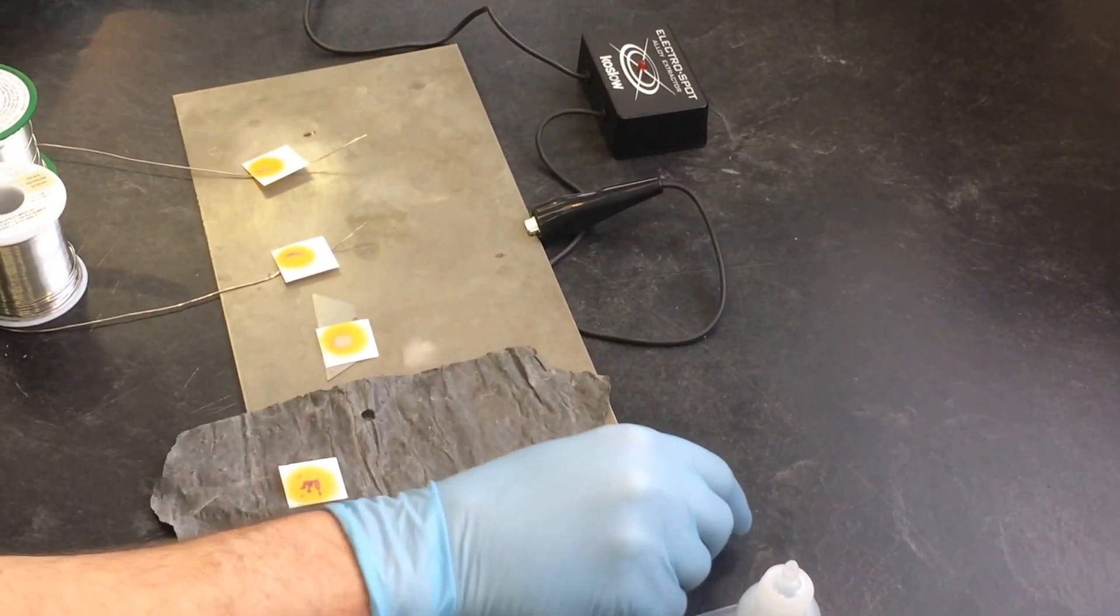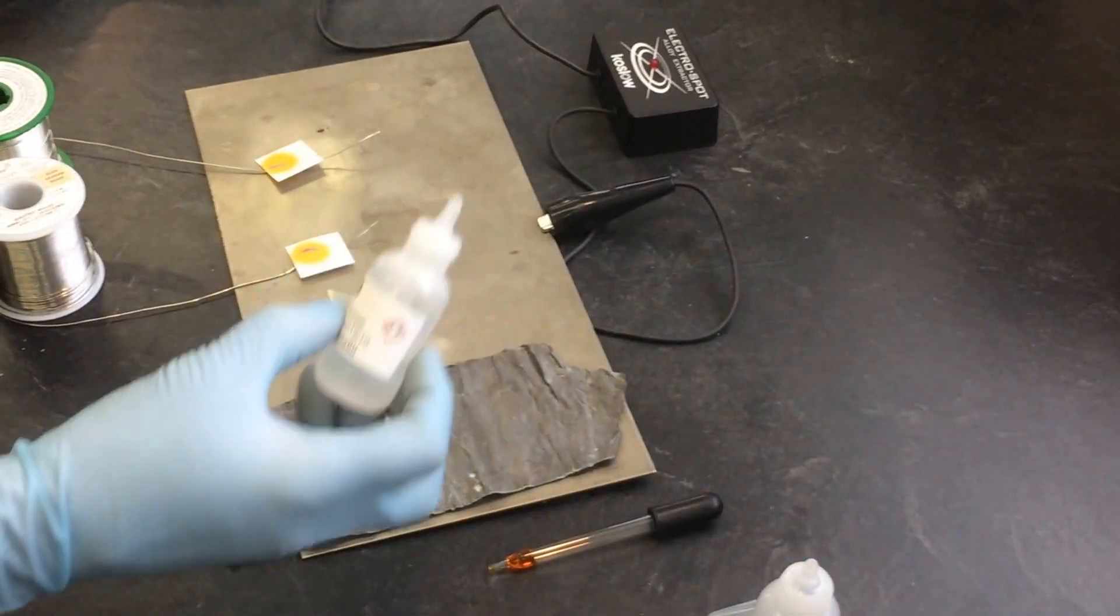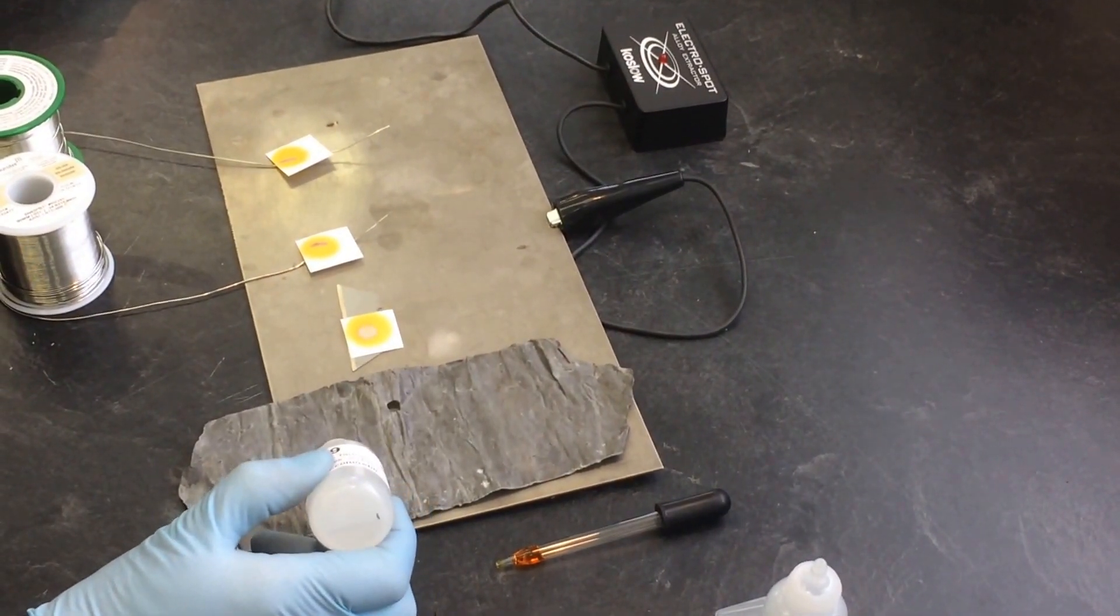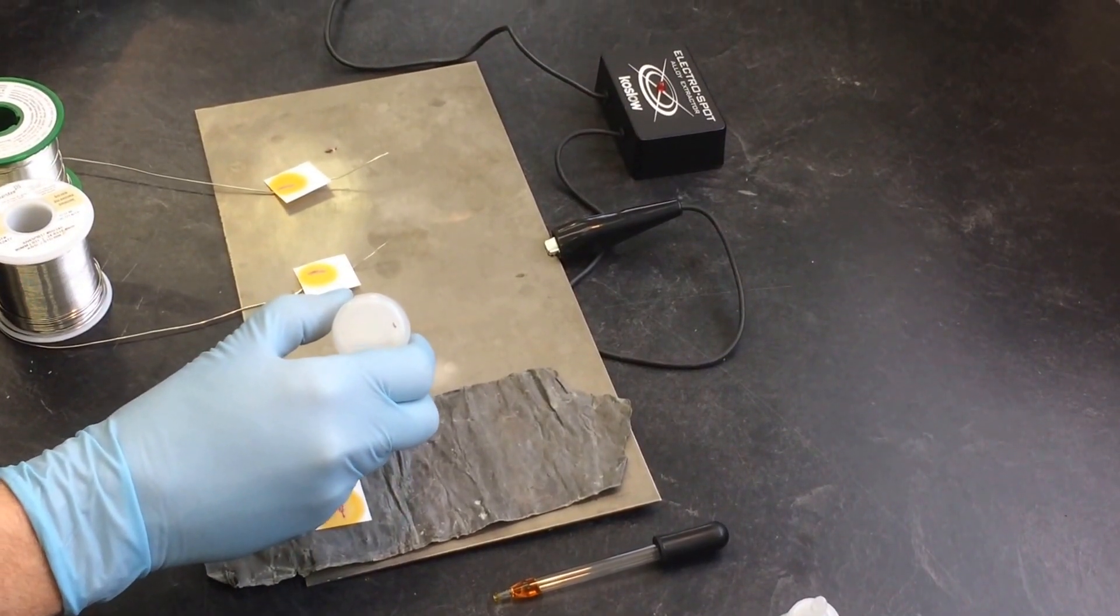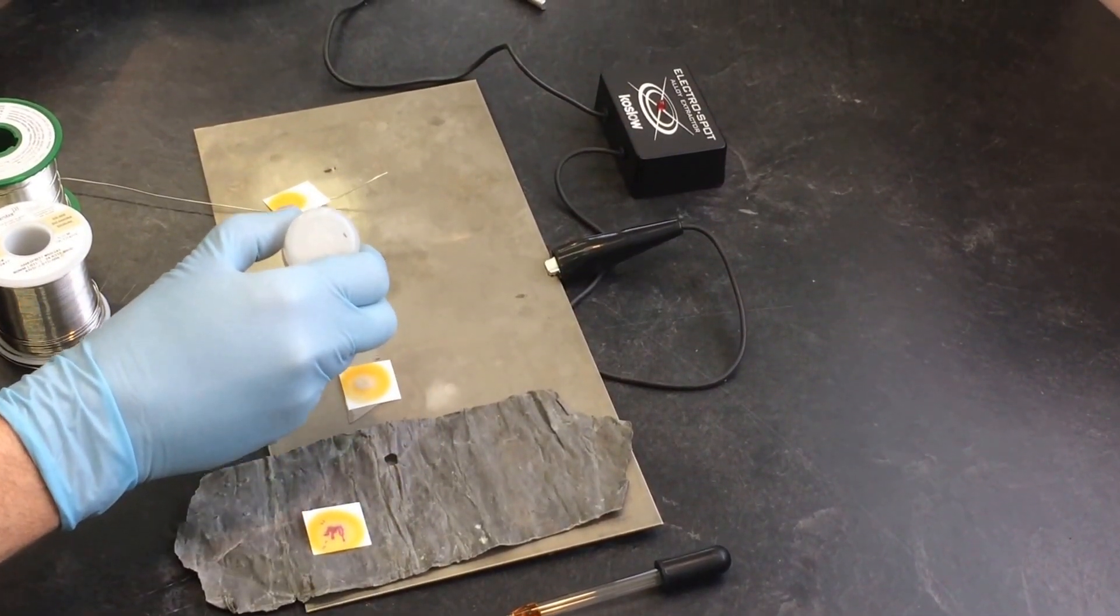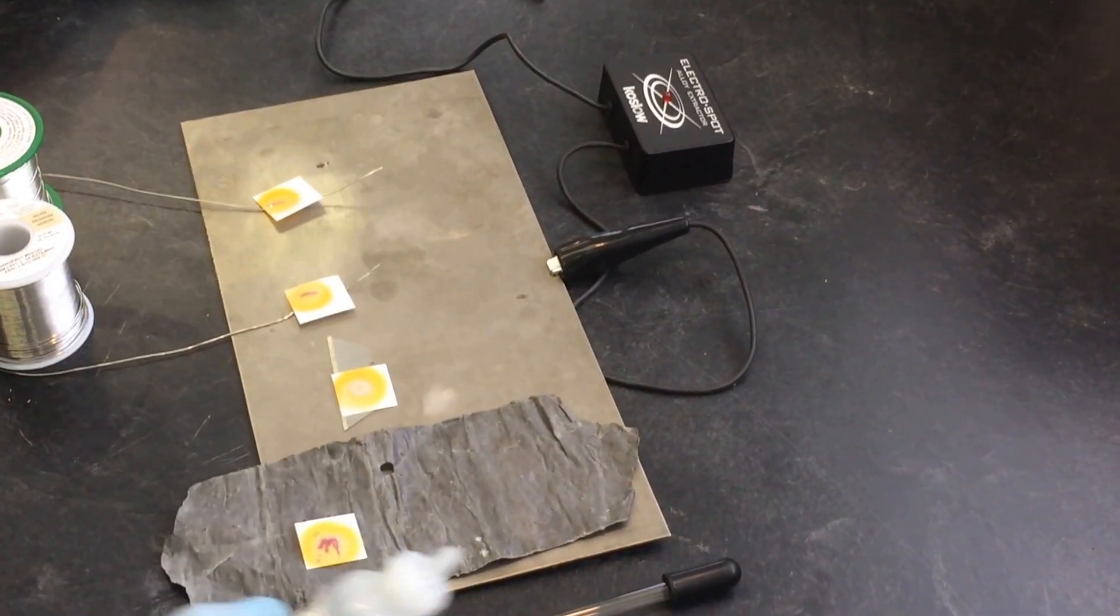Okay, next the instructions call out for Solution 19, put one drop. I think it helps thin out the orange color.